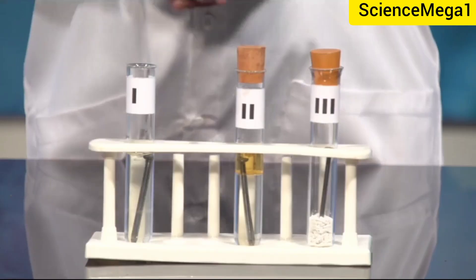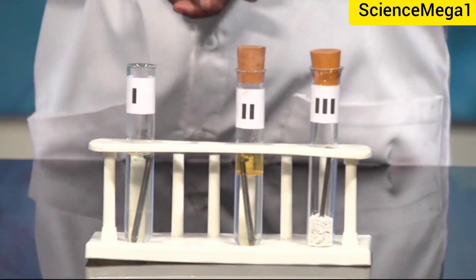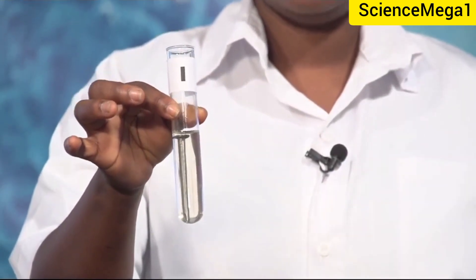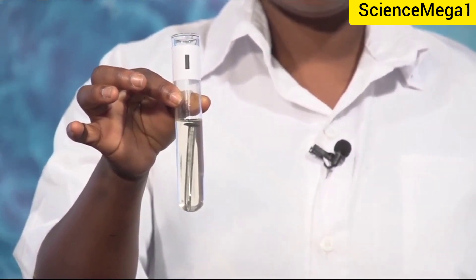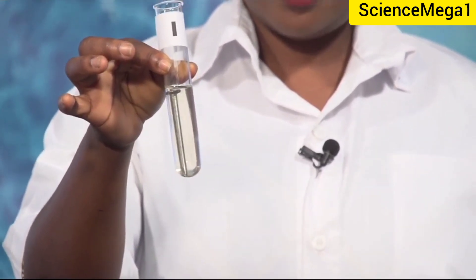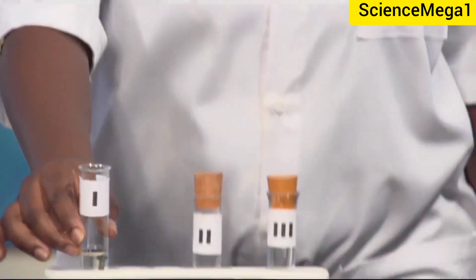Let us go through the procedure for the activity. We have labelled all three test tubes. Test tube one has been filled to about half with distilled water and a nail placed in it, as you can see. This means test tube one has been subjected to both water and air or oxygen.